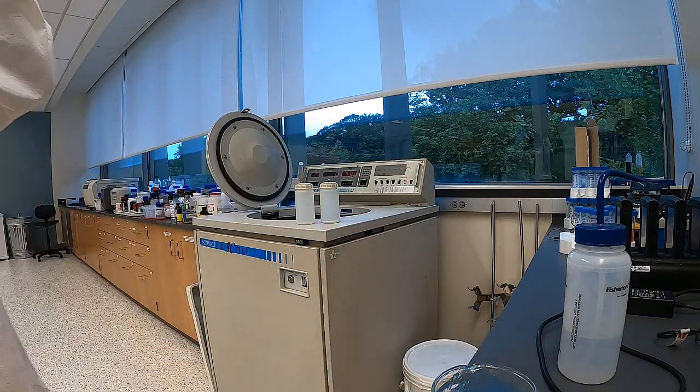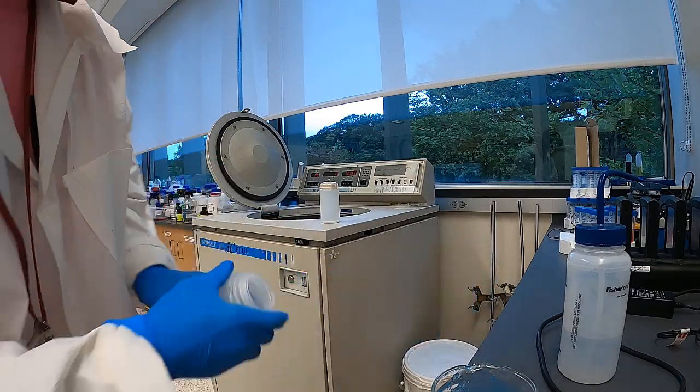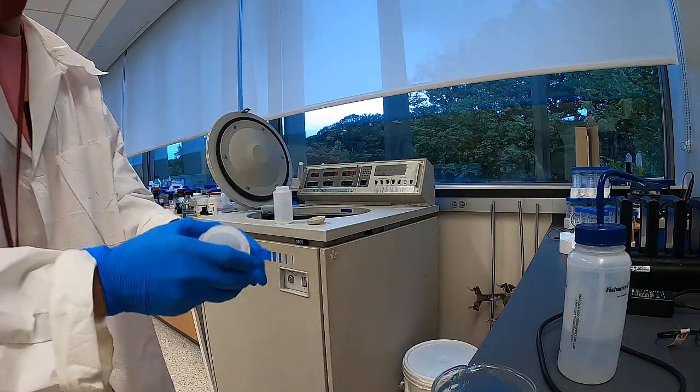So I'm going to go ahead and transfer it to a centrifuge jar. Make sure it's clean.